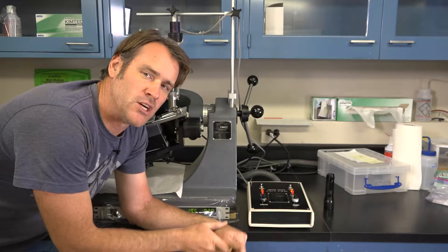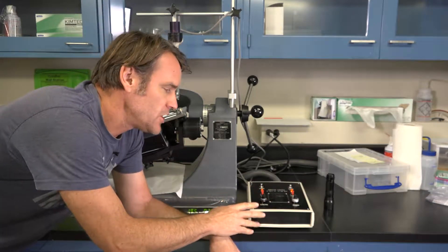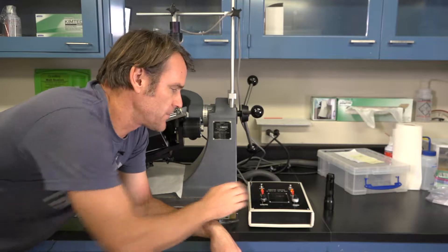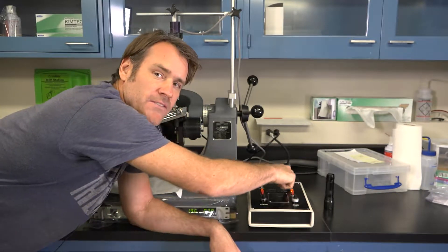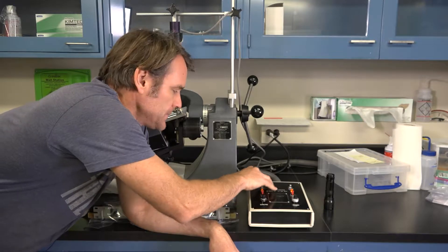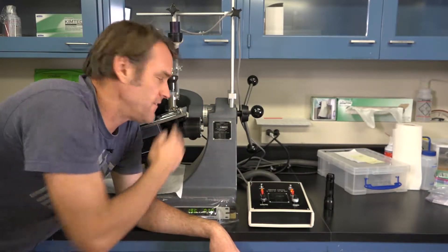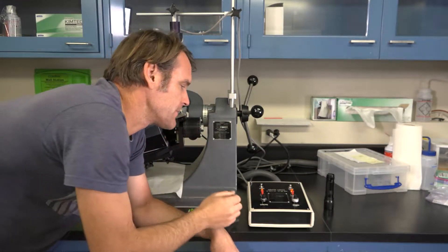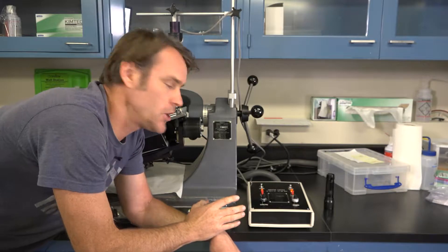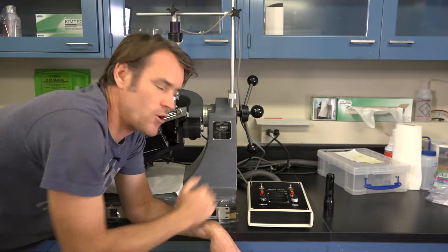Now the entire sample is run through 0.3 magnetics. Before you turn off the feeding system, you want to surge both things. So first, surge the feeder, and then surge the chute. And that will make sure that everything's been knocked off of both systems and it's all in those collection cups. Once you finish doing the surges, you first turn off the feeder, and then you turn off the chute in that order.